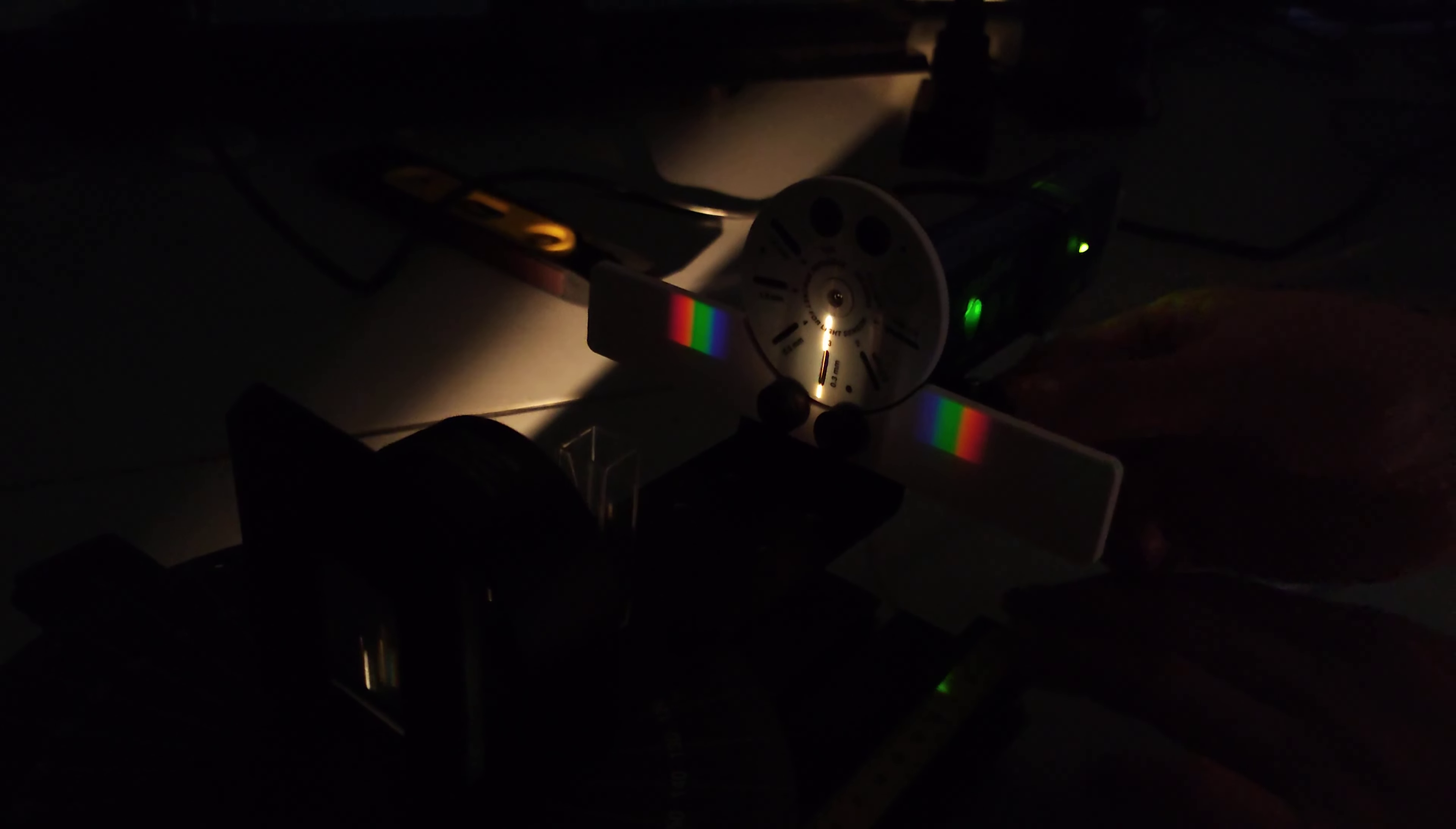I put an empty cuvette. I made it in the center. Then I'm placing it to the 50 degree. Where is that one? Yeah, 50 degree.